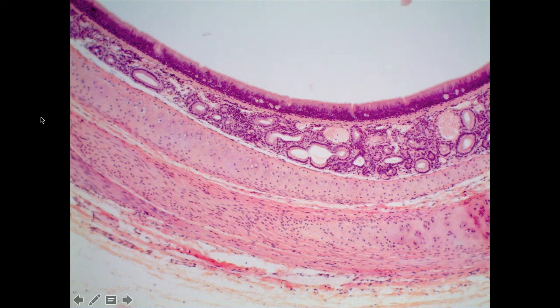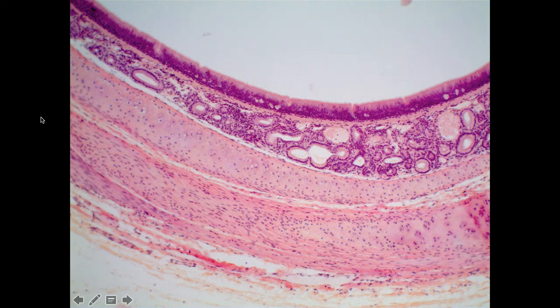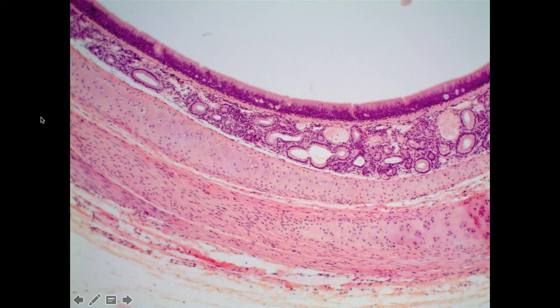For this video clip, we are going to be considering the respiratory system, which only has two slides for you to look at: the trachea and then the lung tissue.